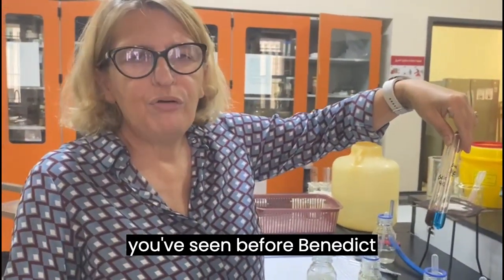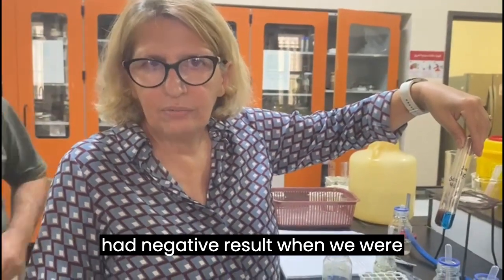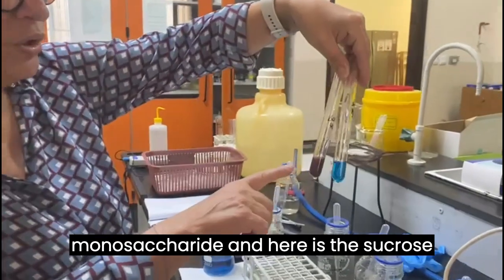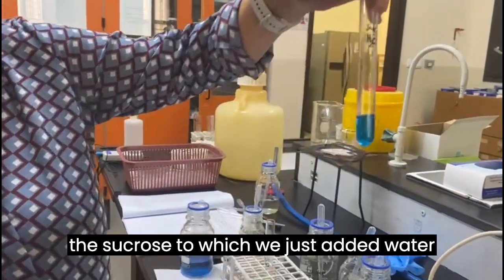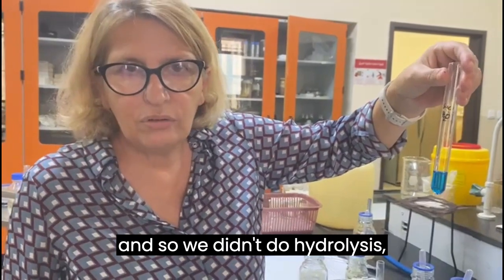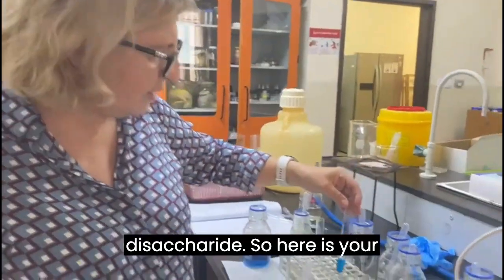You saw before Benedict had a negative result when we were dealing with the disaccharide sucrose, but a positive result with the monosaccharide. And here the sucrose with the HCl is positive, while the sucrose to which we just added water, and so we didn't do hydrolysis, stayed as a non-reducing disaccharide.